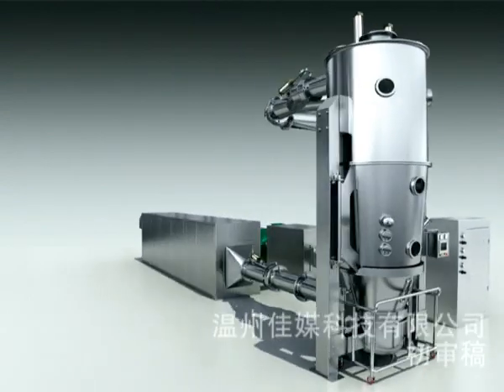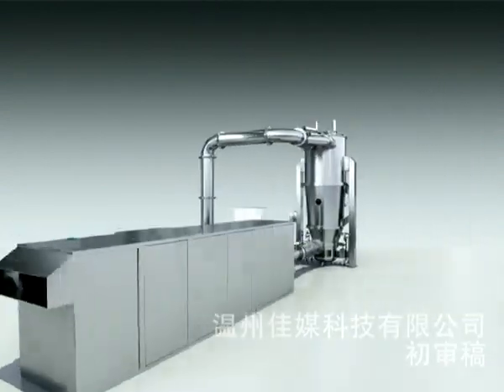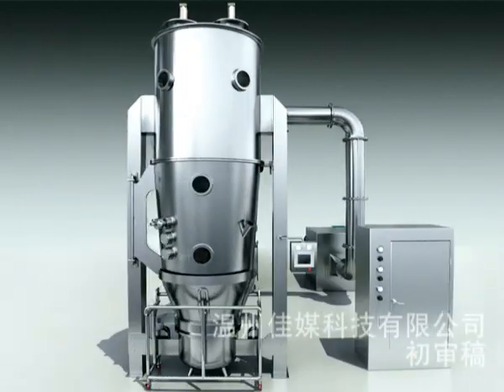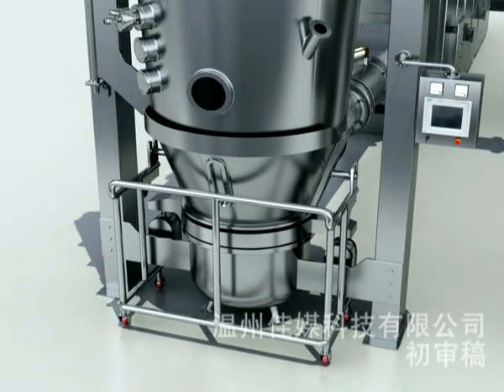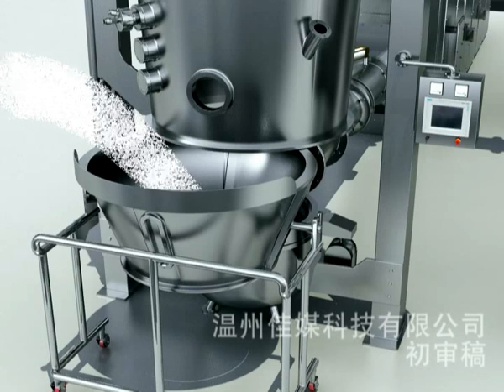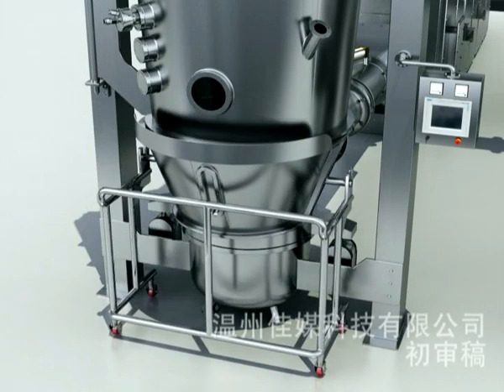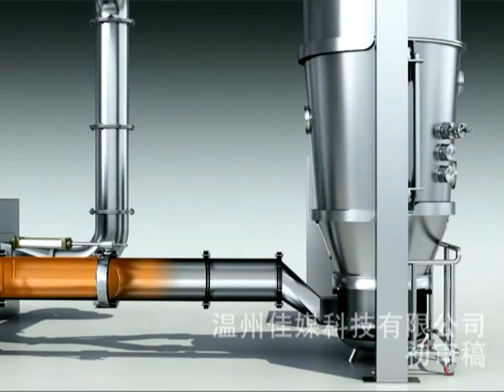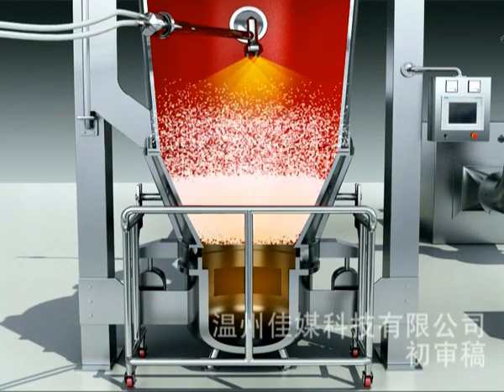Granulating fluid bed. The powder material is loaded in the fluid bed. Heated and filtered, sometimes also dehumidified, air enters into the fluid bed from the hot air cabinet. The powder should be fluidized when the air velocity is high enough.